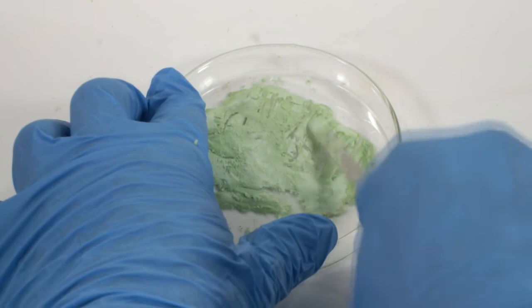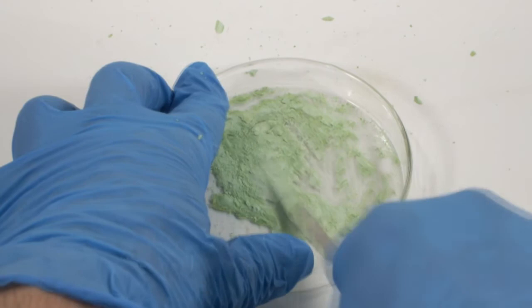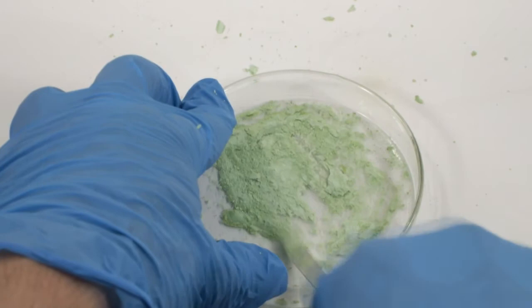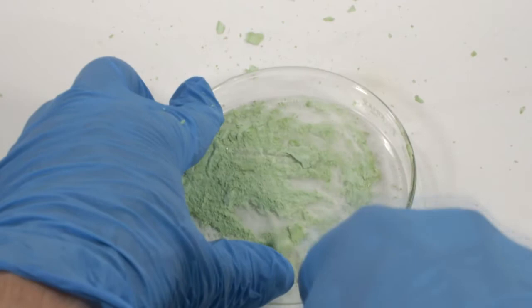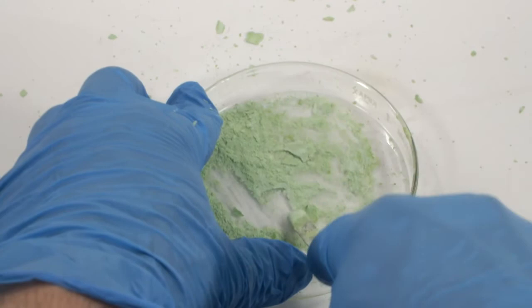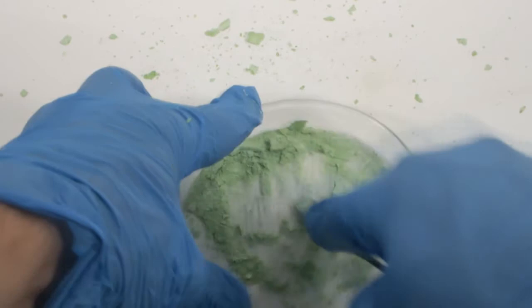Yep, that's it. Nope, it's not even close to purple. Something went horribly wrong. In one of the videos I saw on YouTube, this happened to the residue on the filter paper as it dried. Unfortunately for me, it happened to the entire product. This isn't the complex for sure, and I don't even think it's nickel chloride. That's usually a brighter kelly green color. This is dull, and the mass is far less than it should be. In a nutshell, I have no idea what happened.